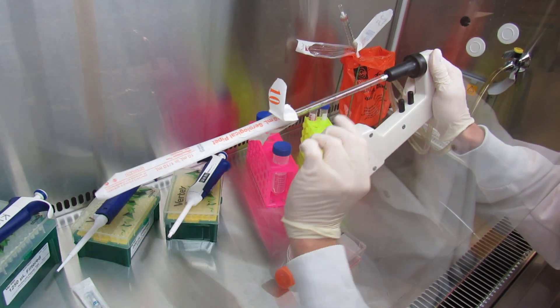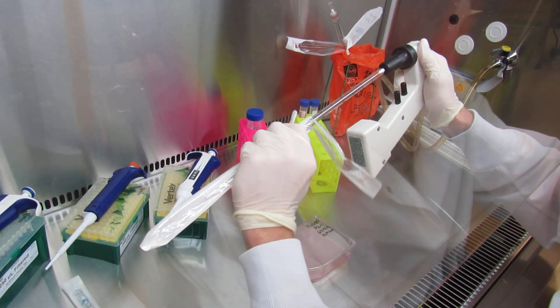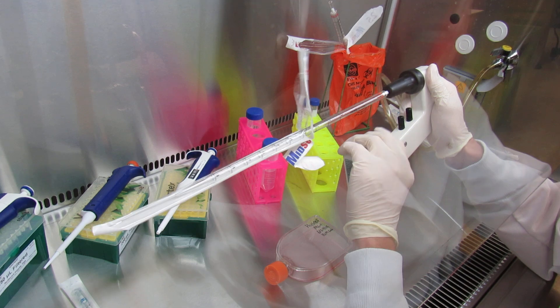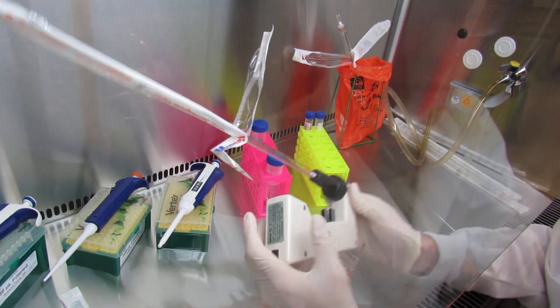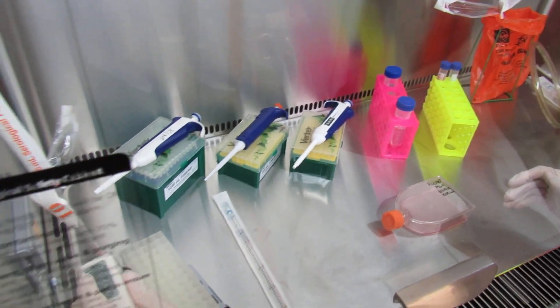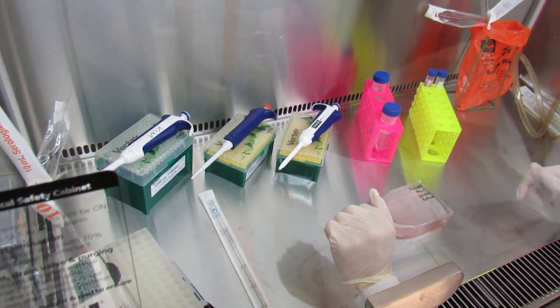It's easiest if you rotate the pipette aid from this side all the way around if you're left-handed so you can see it, or if you're right-handed, keep it like that so you can see how much you're pipetting in or out. I will set this aside as we don't need it right now, but it is ready for when we need it in the future.